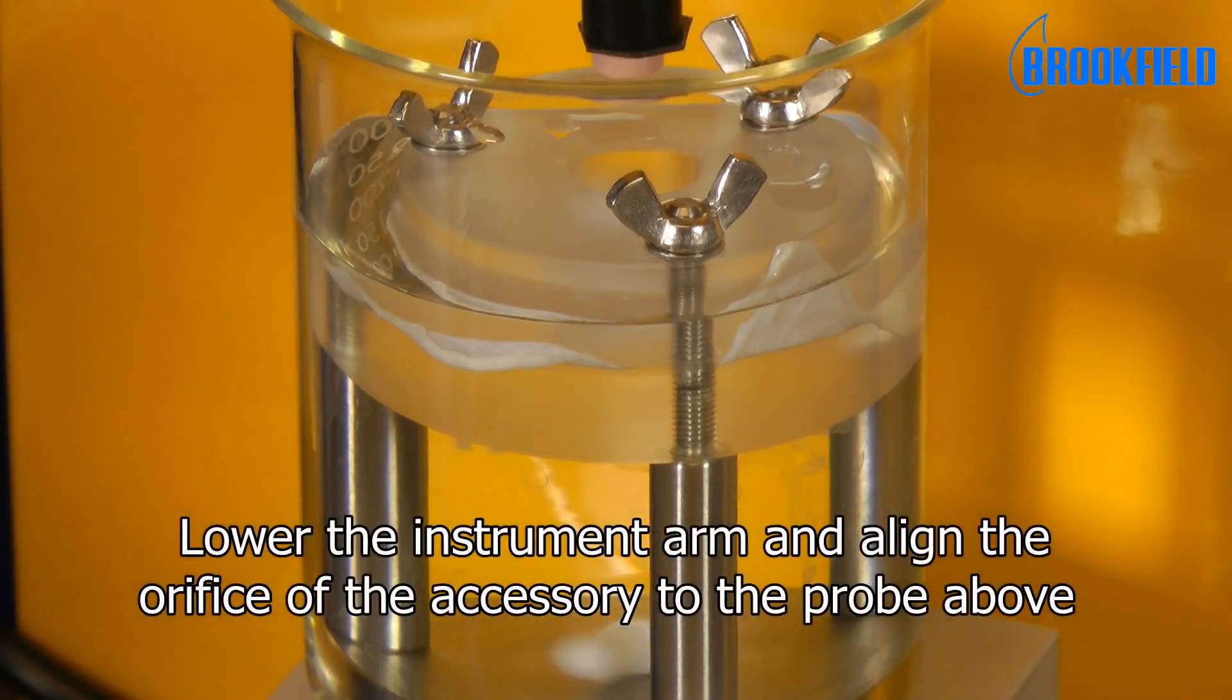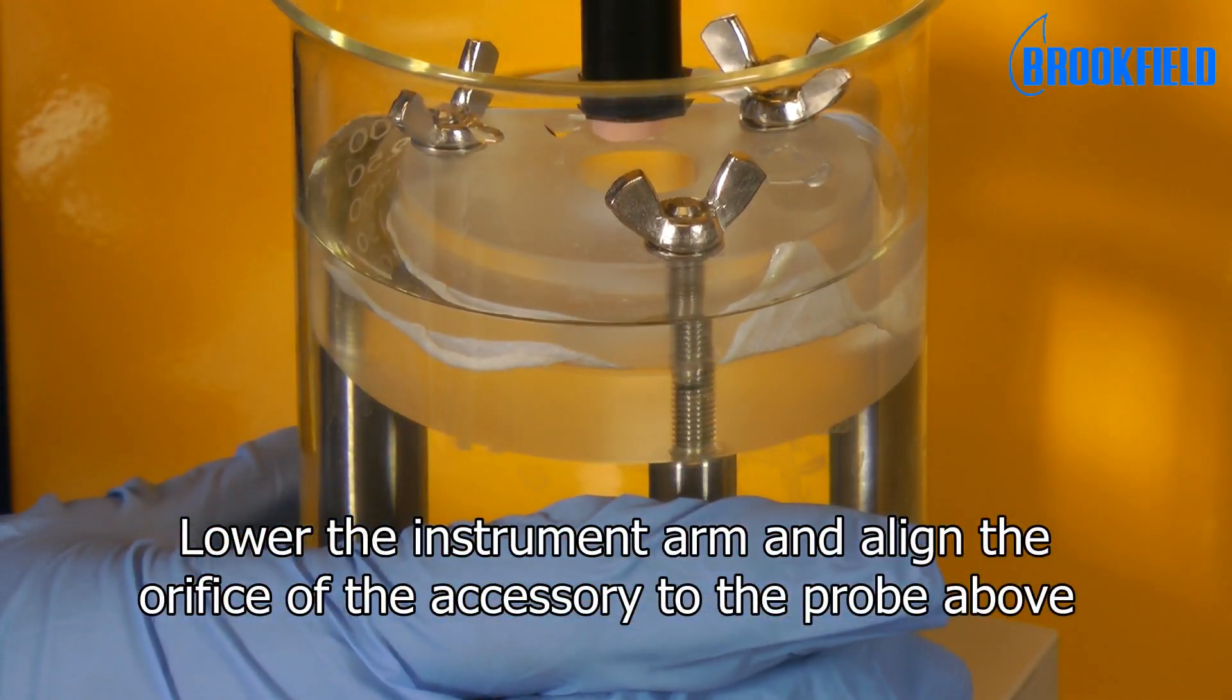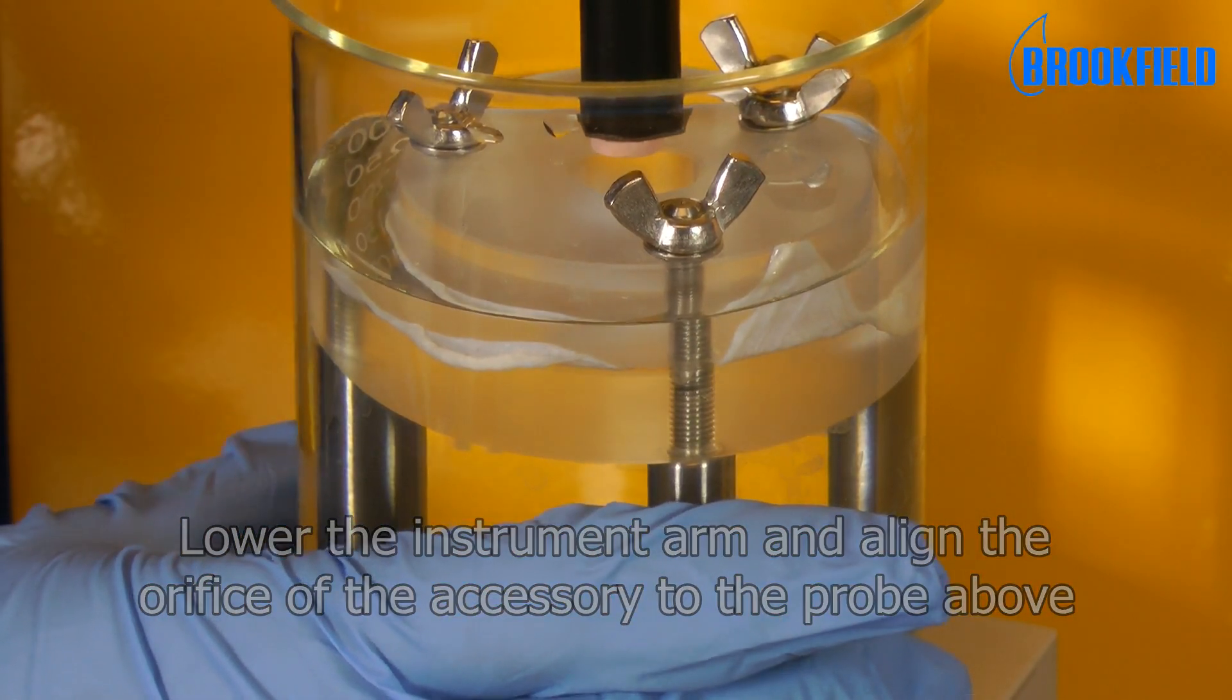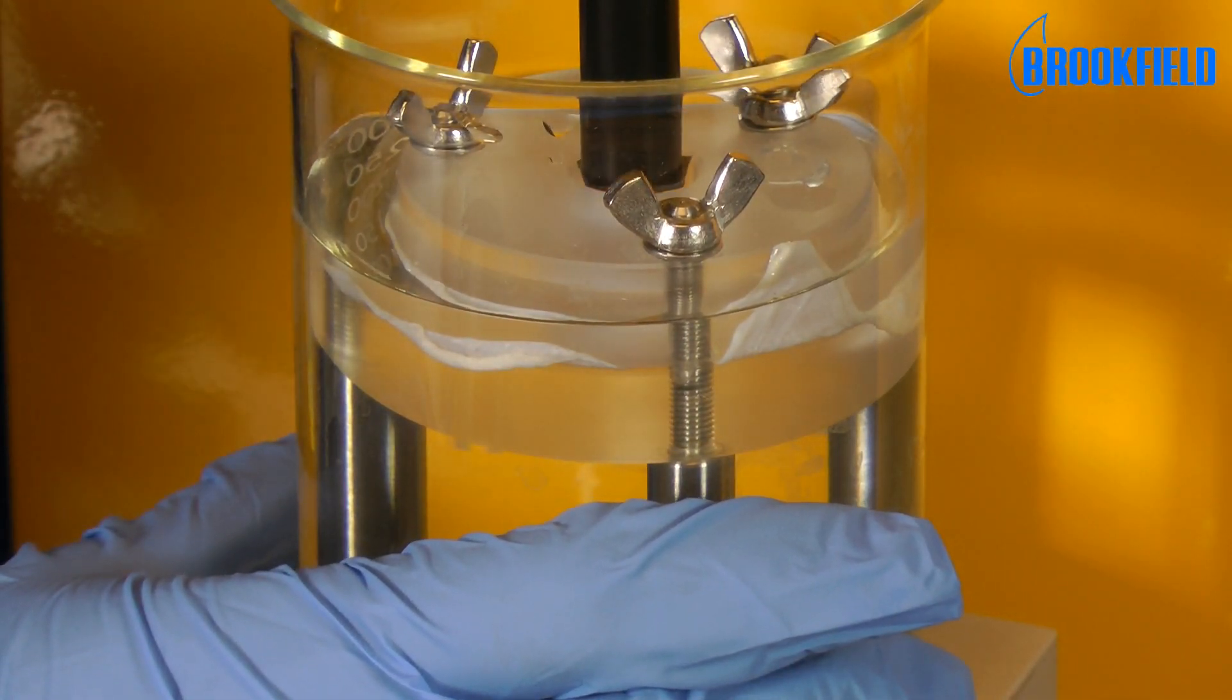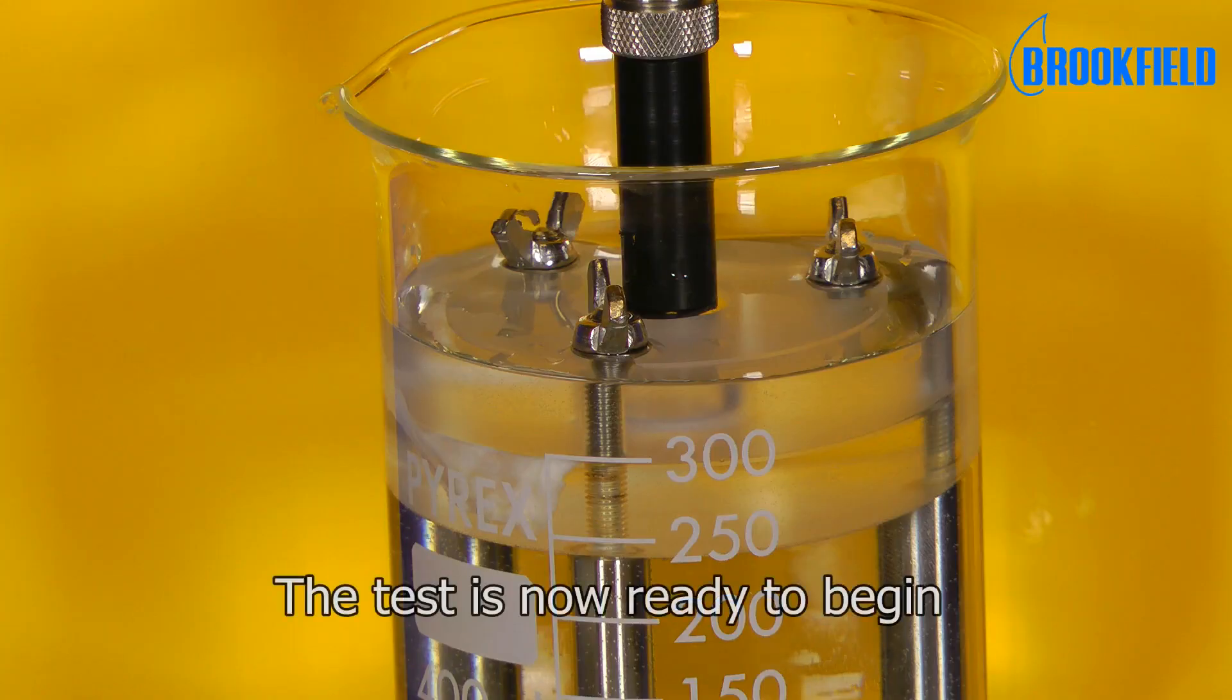Lower the instrument arm and align the orifice of the accessory to the probe above. The test is now ready to begin.